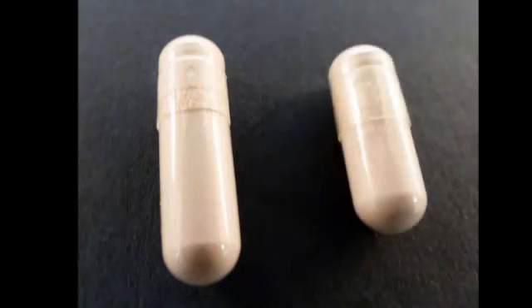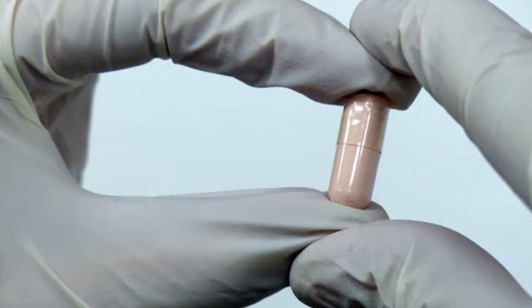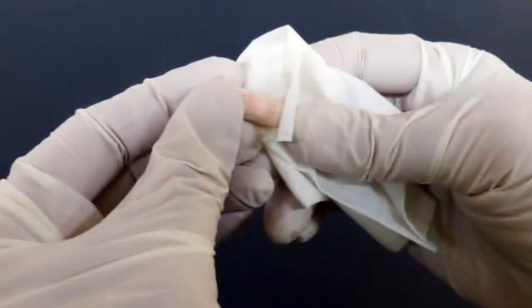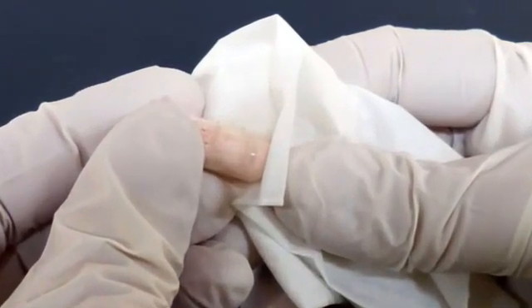When the weight and fill of the capsule is correct, lock the capsule. Gently push the head down onto the body of the capsule until a click is felt. Do not push too hard, as the capsule shell can become dented or overlocked. Once the capsule is locked, shake it to evenly distribute the powder into the head of the capsule. Wipe off the surface of the gelatin capsule with a clean, dry paper towel to remove any excess powder.